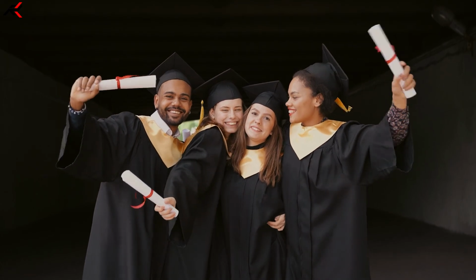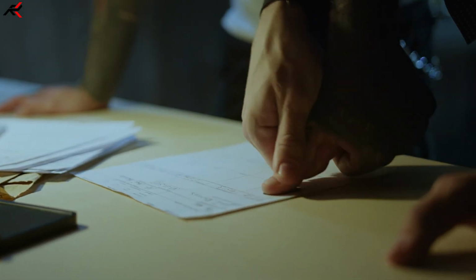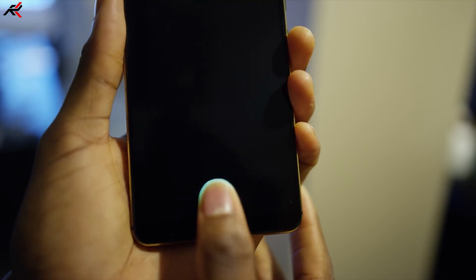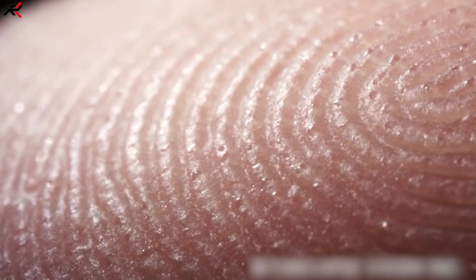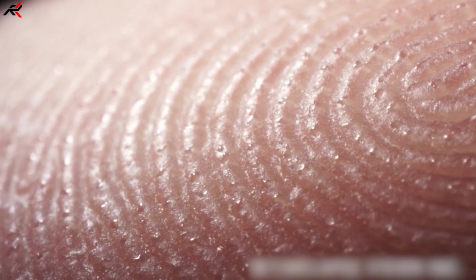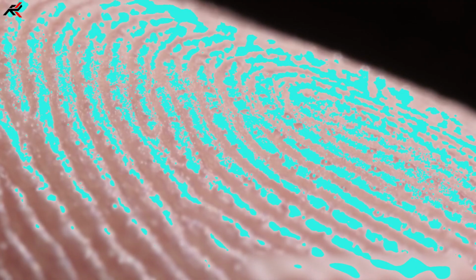Guys, it does not matter how educated we are, because we have to put a thumb impression when needed. Even phones nowadays do not open without fingerprints. But have you ever looked at your thumb impression under a microscope? Exactly what it looks like. When you look at your thumb impression under the microscope, you will clearly see the lining of the fingerprint, where sweating also comes from, as you can see. And this is the edge that does not match with any other.